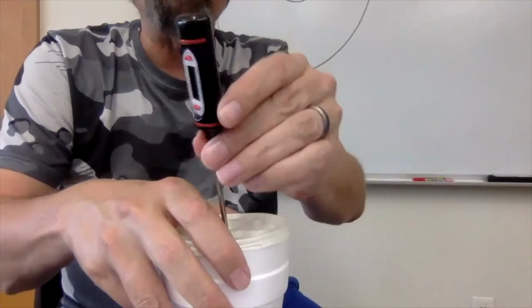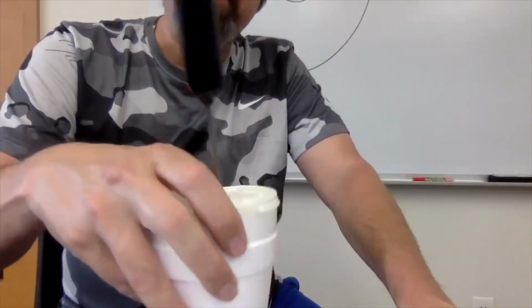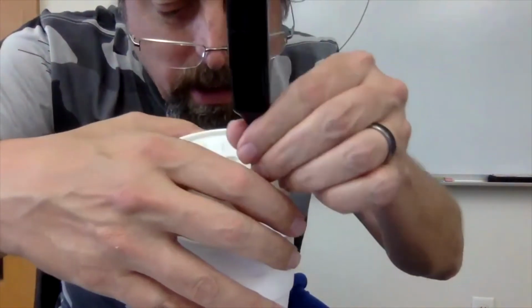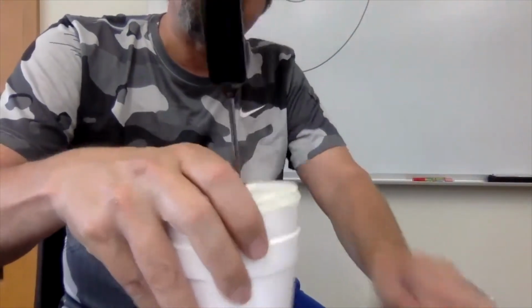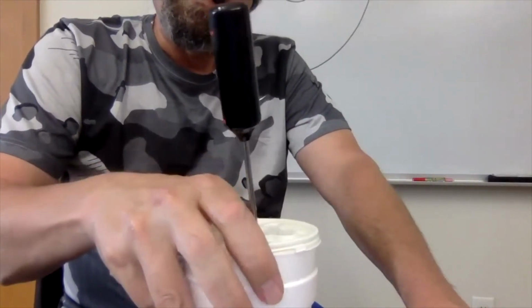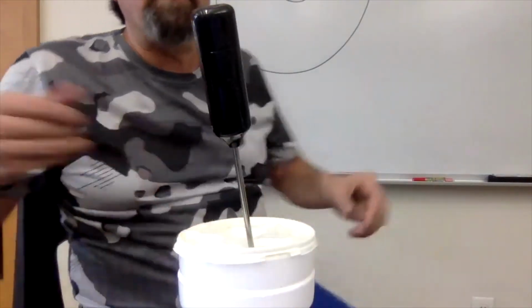I'm thinking this might be close to the end. I'm at 26, which is exactly 2 degrees C change. Just sneak a peek in here, see if there's anything left over. There's a couple little flakes maybe. I'm going to see if it gets up to 26.1. It's like 26 is as far as it's going to go. Okay, so I'm going to move my camera over here to show you some of the calculations.